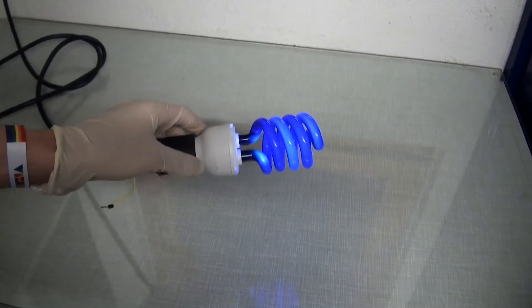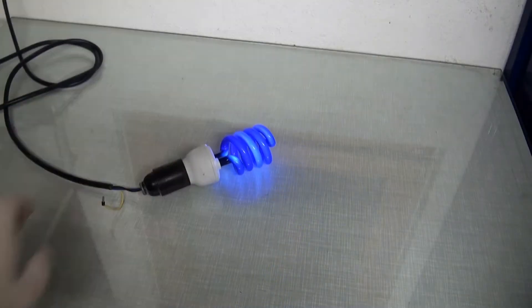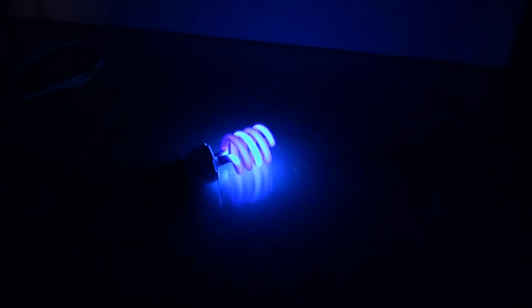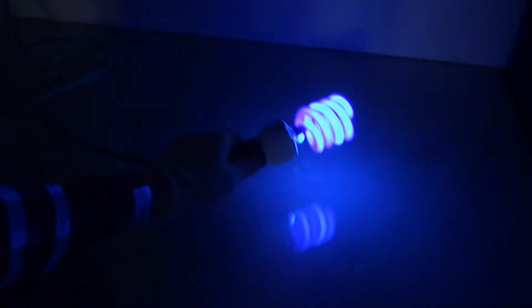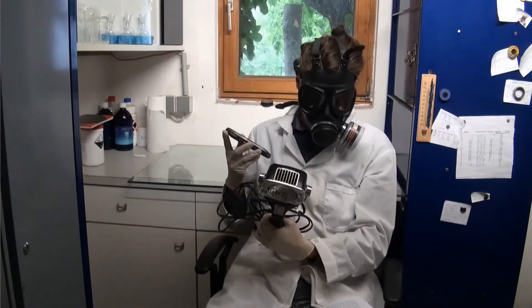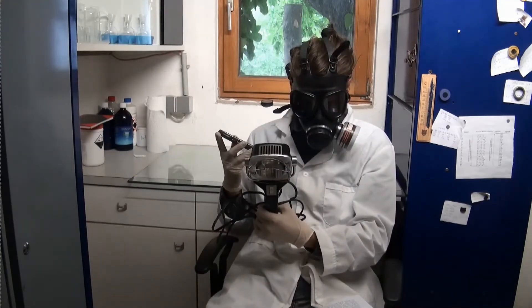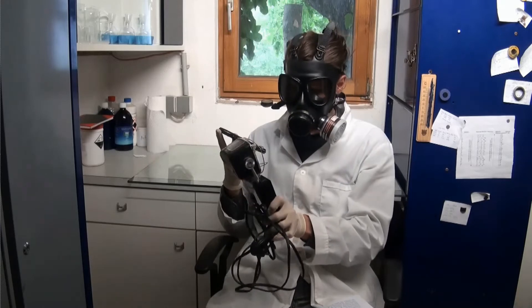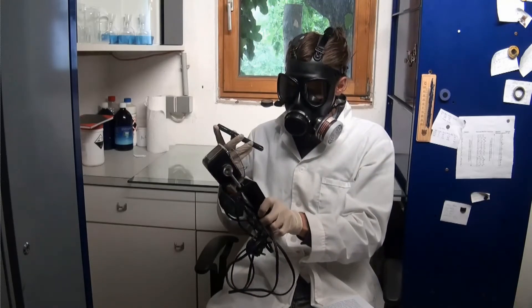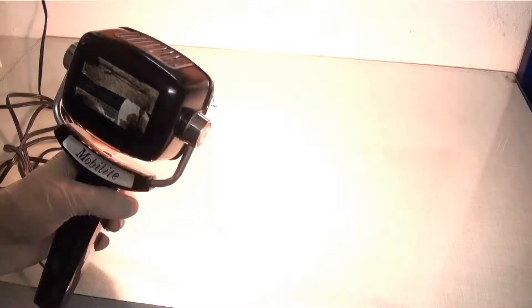This is a 40 watt black light which should produce UVA light between 315 and 400 nanometers. I also found this old and extremely unsafe 600 watt tanning lamp at my mother's stuff. Like you can see, it is extremely bright to the point where I have to wear a welder's mask. Feels like holding a tiny sun in my hand. Although I am not sure about its spectrum, it should still have a lot of power in the UV range.